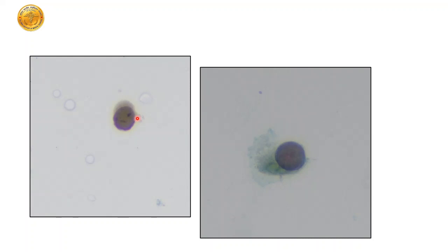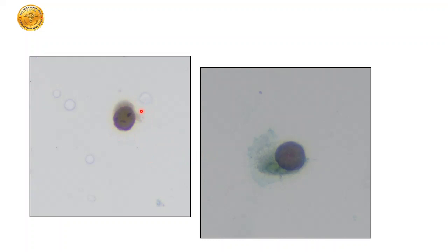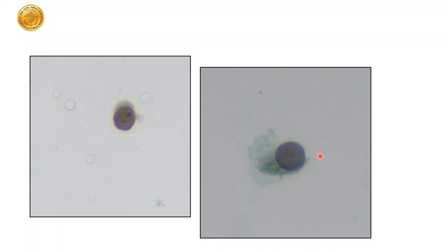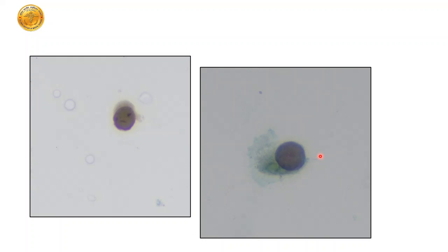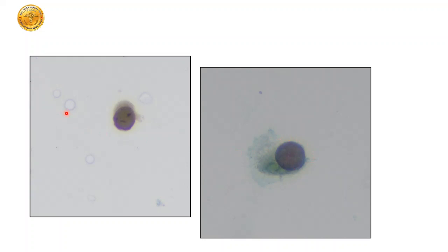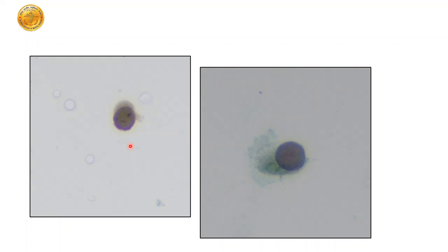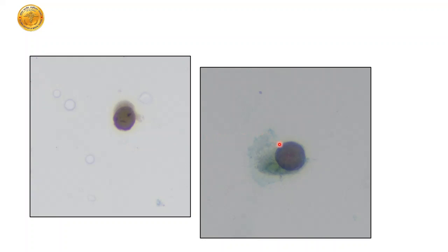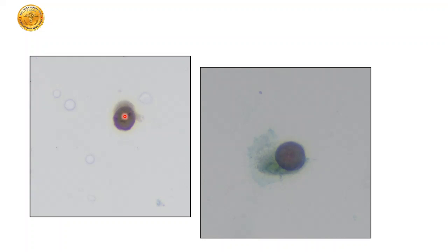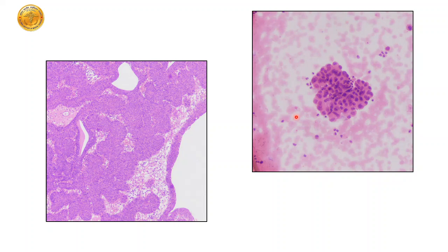Another case: a cell with a high N:C ratio — this was a post renal transplant recipient and the urine showed nice decoy cells. You can see a nice intranuclear basophilic inclusion, almost like a comet tail — these are also called comet tail cells or decoy cells. This represents BK polyoma virus infection. The corresponding histopathology section showed benign urothelial tissue fragments with no fibrovascular core, just occasional fragments with community borders — what we called papillary but there was no fibrovascular core.